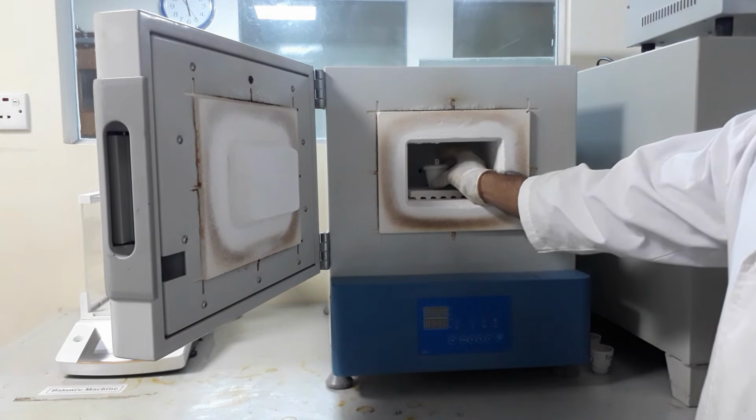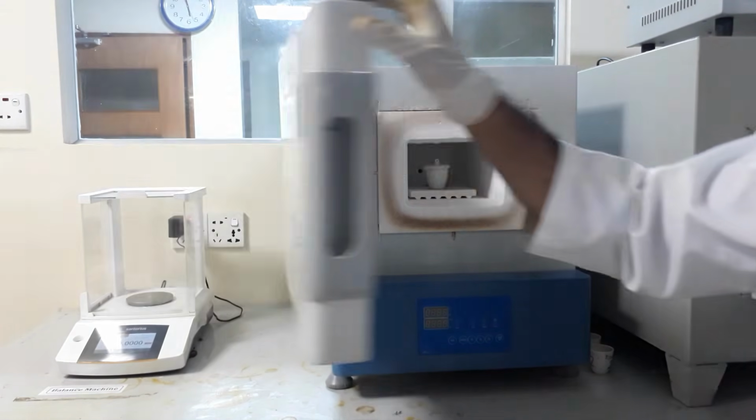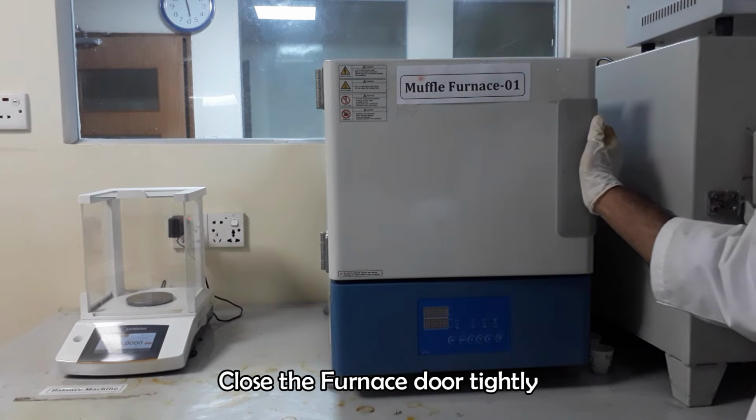Place the crucible in muffle furnace and burn the fiber at 550 degrees Celsius for 2 hours.